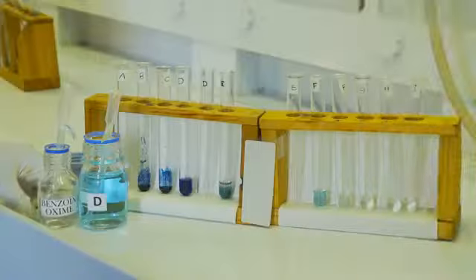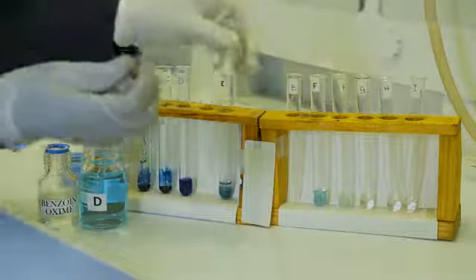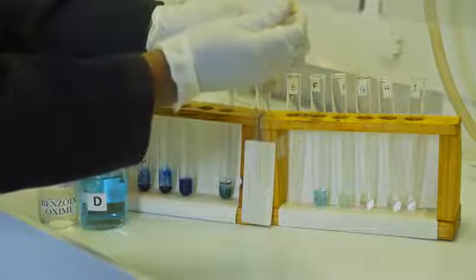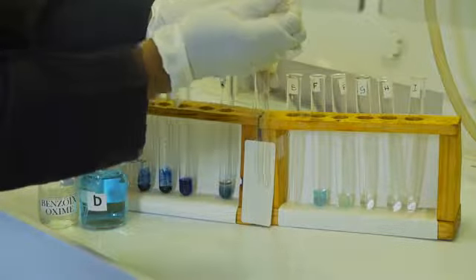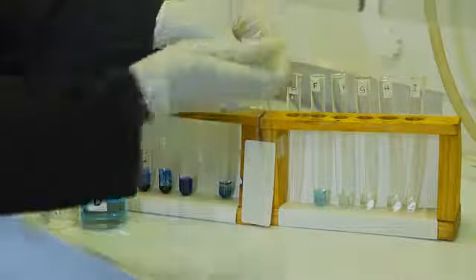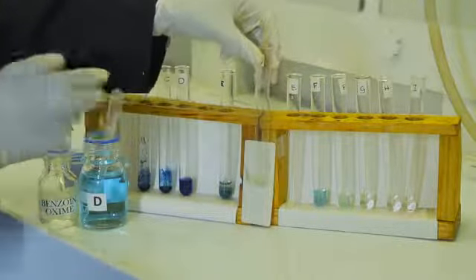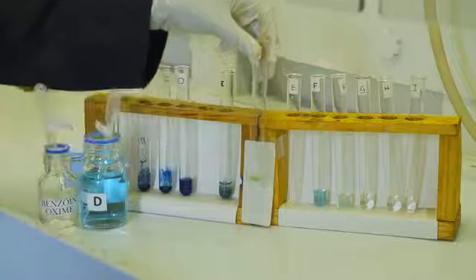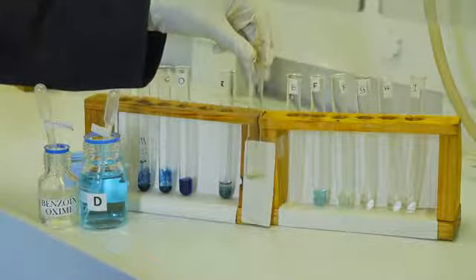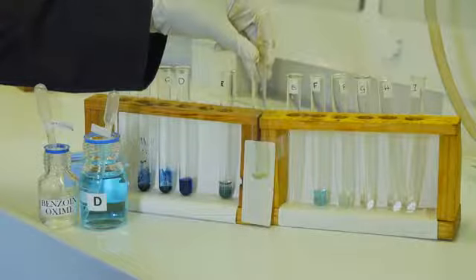In the next experiment, I will be mixing five drops of benzoin oxime with two drops of the cation solution suspected to contain copper 2+ cations. The green precipitate indicates the formation of copper benzoin oxime, which confirms the presence of copper 2+ cations.